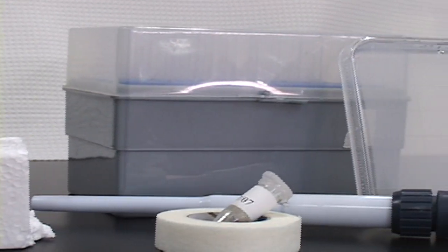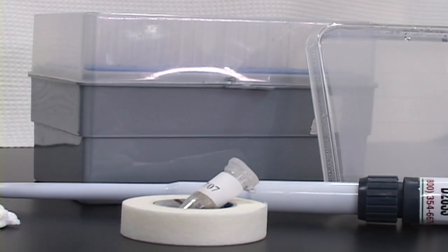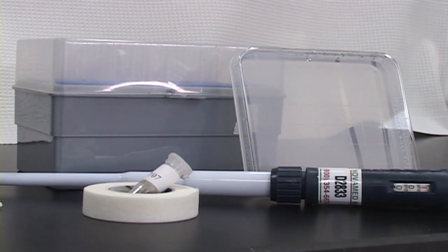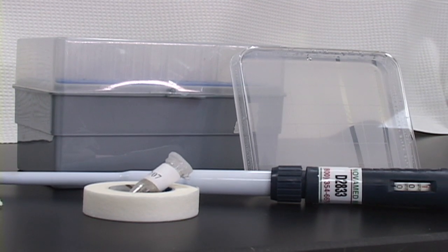In addition, you will need the following materials: a P1000 micropipetter and tips, agar growth plates and micropore tape, and of course, aliquots of the Arabidopsis seed in a sterile microfuge tube.